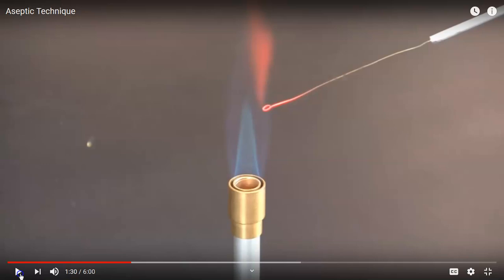The problem with that is you're completely negating all of the effort that you did to sterilize the loop. You can pick up bacteria from the paper towels as well as from the back of your hand. They go onto the loop, and then when you use that loop in your experiments, you'll contaminate them. So never let the loop touch any other surface except for the surfaces that have the bacteria that you're interested in working with.